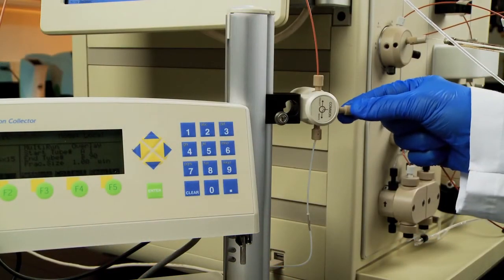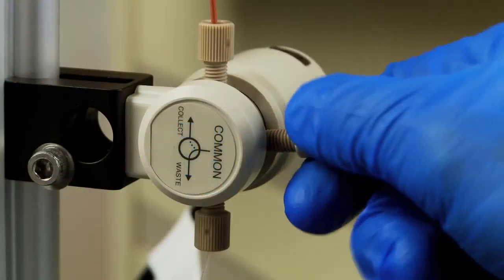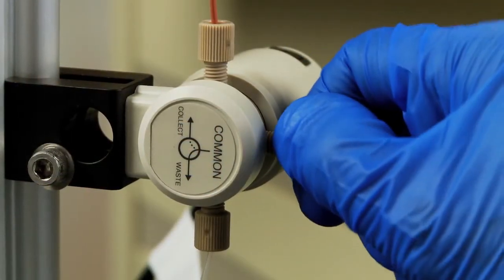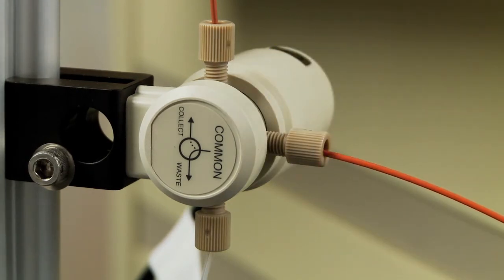Lastly, connect the other end of line number four into the common port of the diverter valve on the BioFrac fraction collector. Follow the instructions for the BioFrac to complete its plumbing.